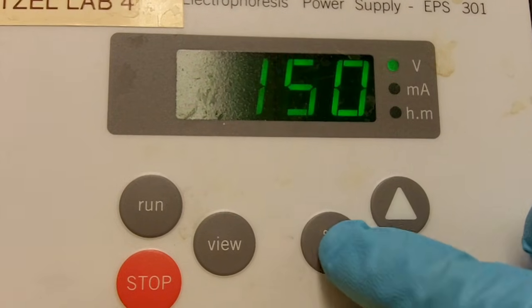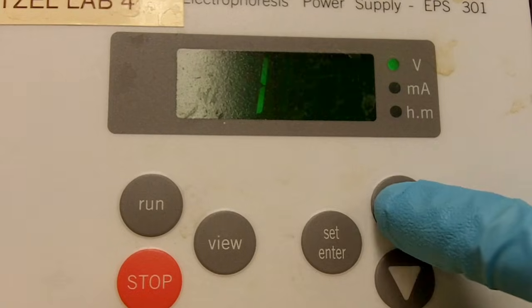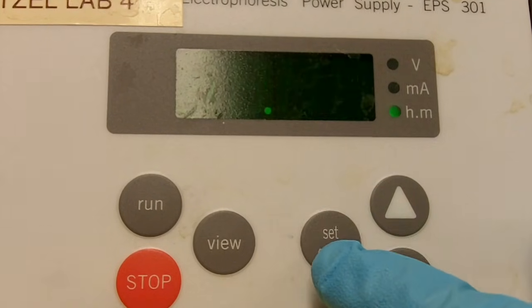And then we set the voltage at 100, and then we run it for approximately an hour.